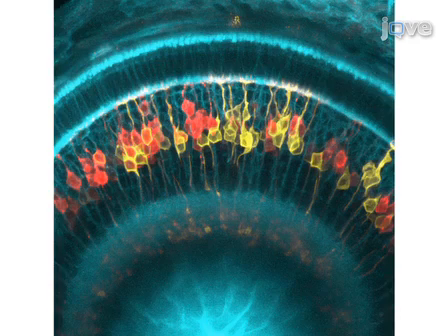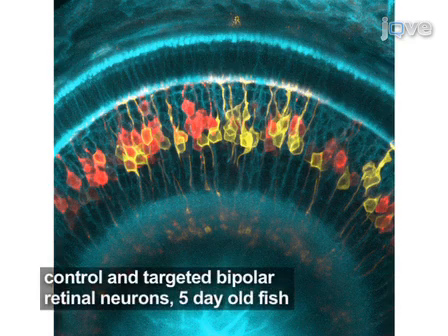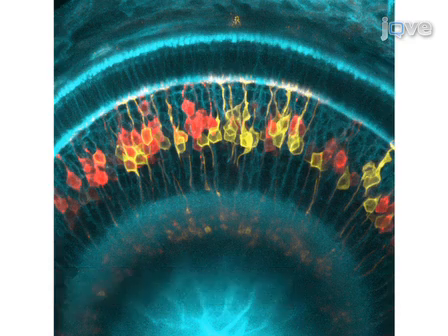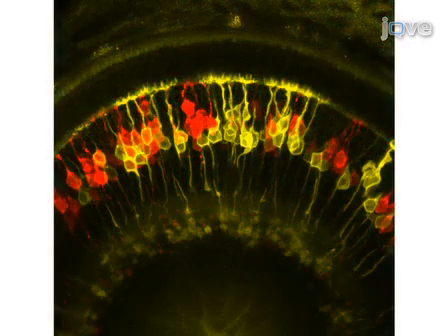To examine targeted loss and regeneration of nitroreductase M-cherry expressing retinal bipolar cells, a time series of confocal images were taken in individual zebrafish. Prior to treatment, there is mosaic expression of membrane-tagged YFP reporter in control bipolar cells, shown in yellow, and nitroreductase cherry fusion protein in targeted bipolars, shown in red. The membrane-tagged CFP transgene, shown in cyan, provides contextual information about most other retinal cells. For added clarity, the same image without the CFP signal is shown.